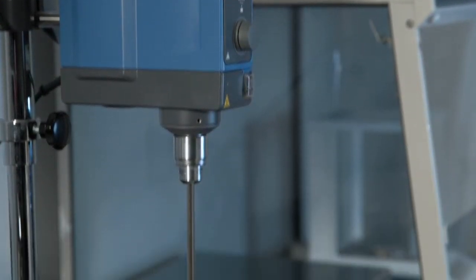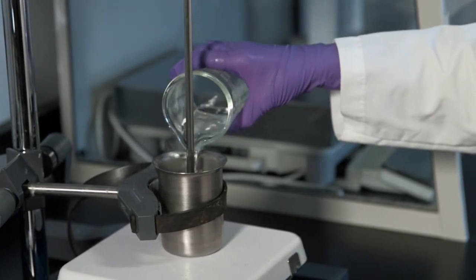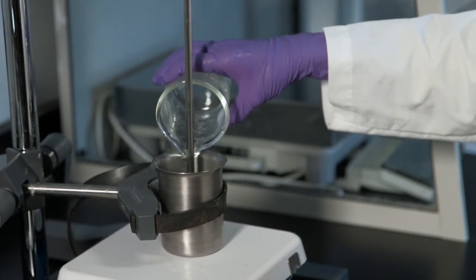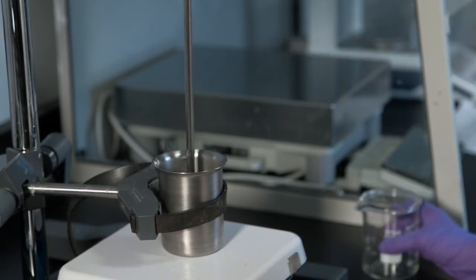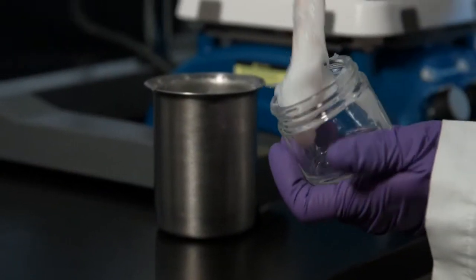Mixing while cooling is critical and can influence the formation of crystalline species. A slow, consistent stir rate will ensure uniformity and minimize the introduction of air. Once cooled, the formulation should be stored in an airtight container.